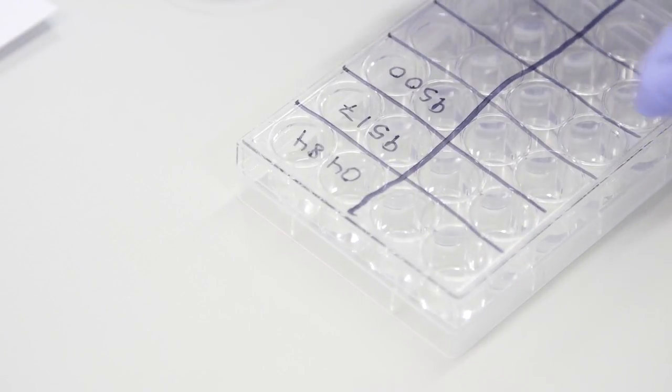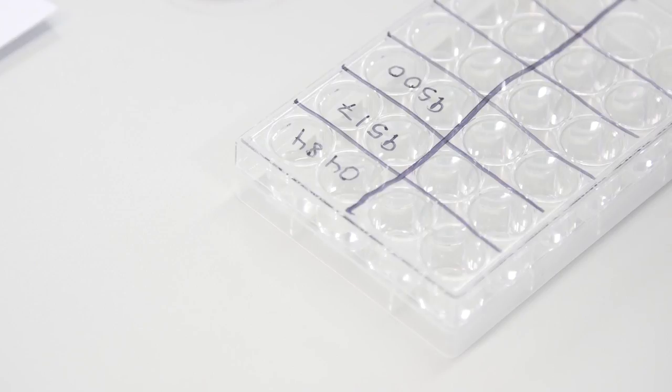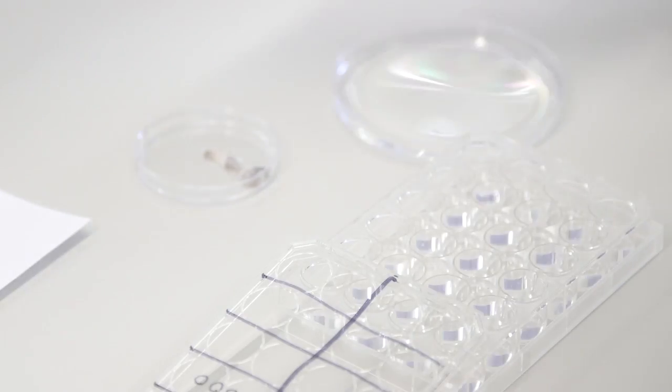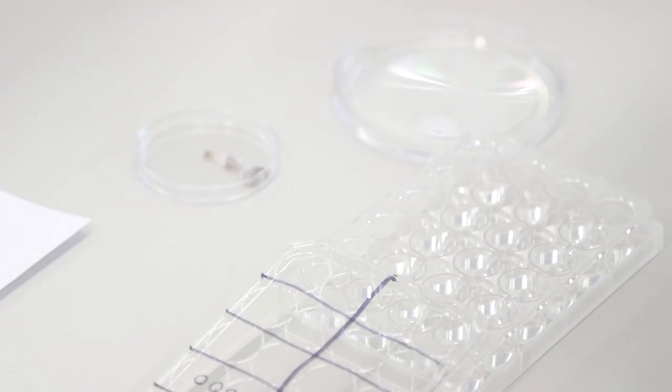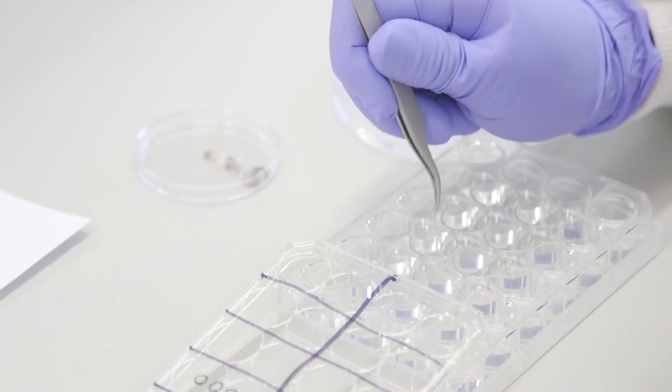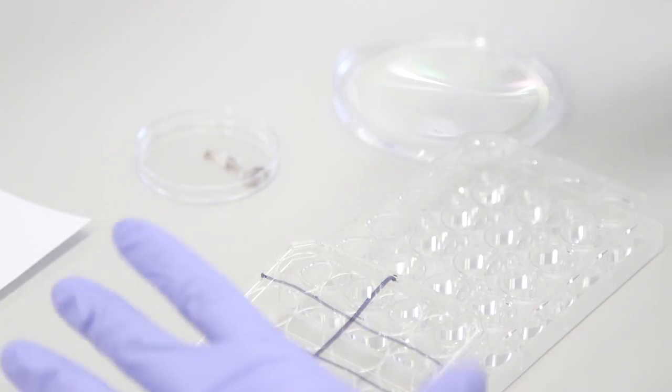Continue this second ear-peeling process with all ears on the 12-well plate until all epidermal sheets are in the 24-well plate.